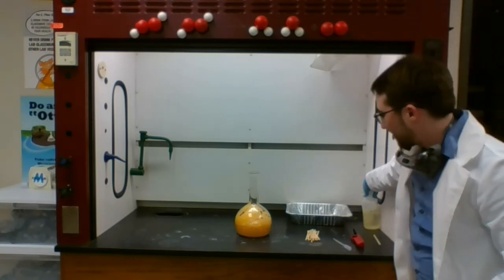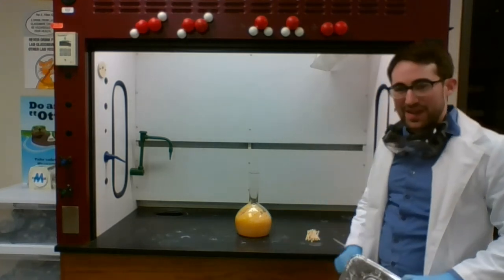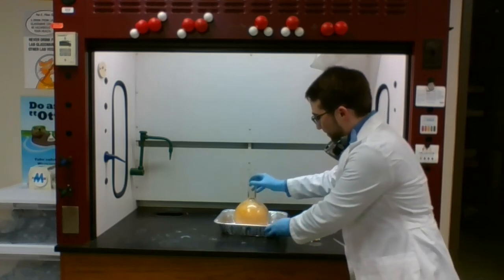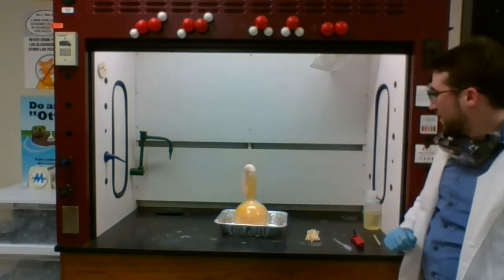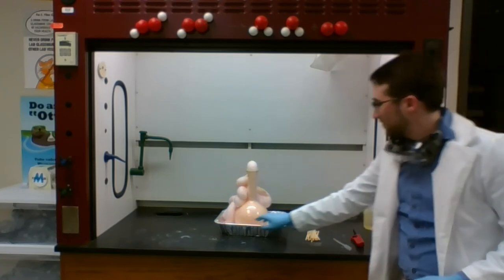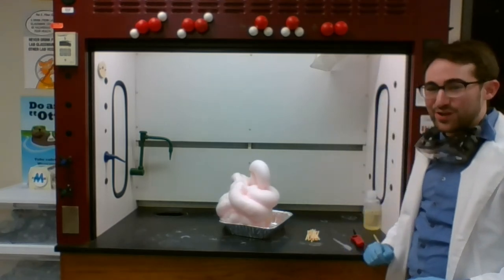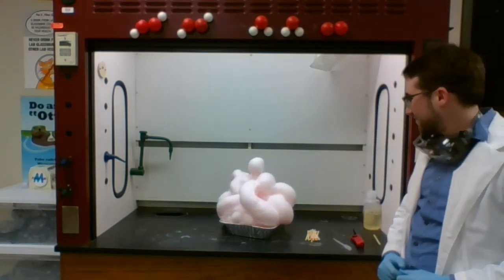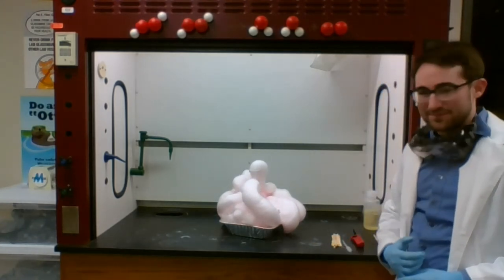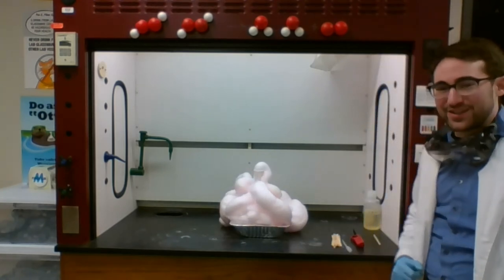So our hydrogen peroxide is decomposing into oxygen gas. It's being caught by the dish soap making this foam. I'm going to move this into this dish so I can catch the results. There it goes. We call this reaction elephant toothpaste for obvious reasons.